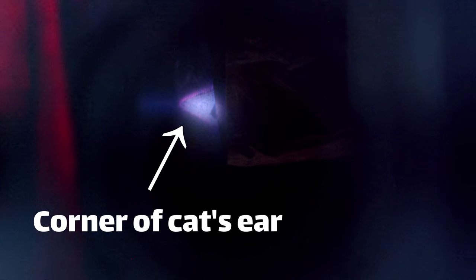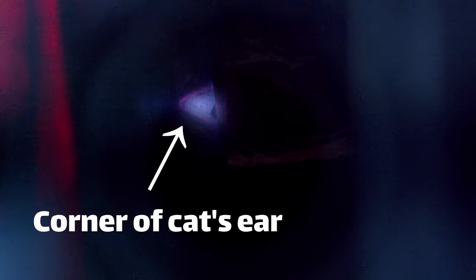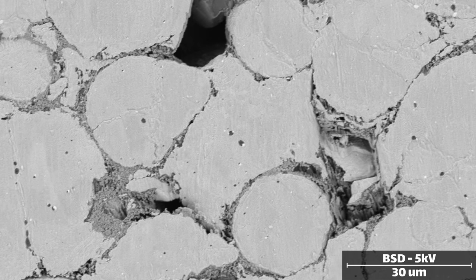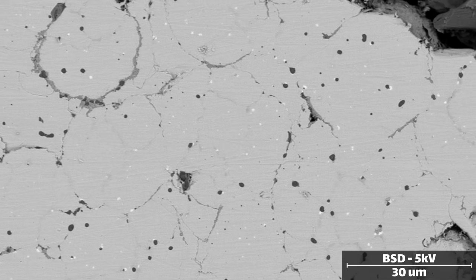But a few minutes in the ion mill with very gentle settings was enough to smooth out some of those scratches. It's not perfect, and a professional with a modern machine could do a lot better. But it does show how gentle ion milling can be.